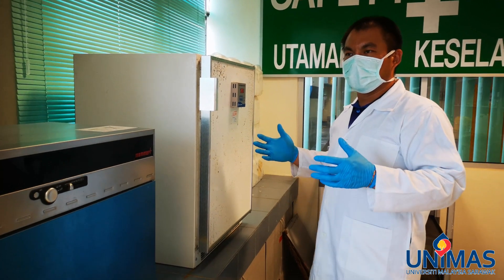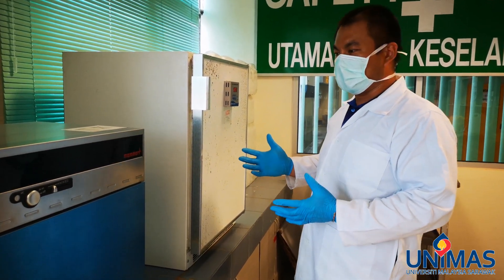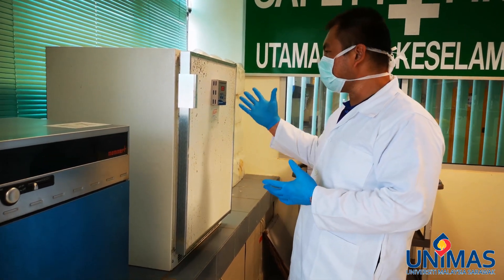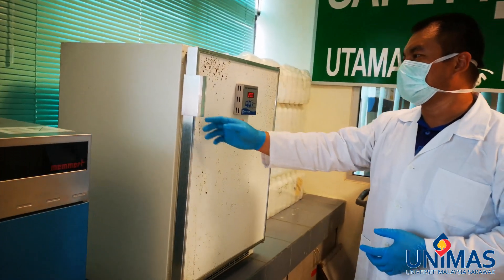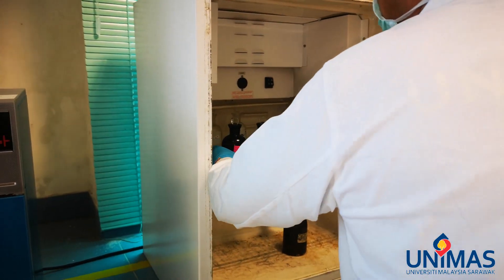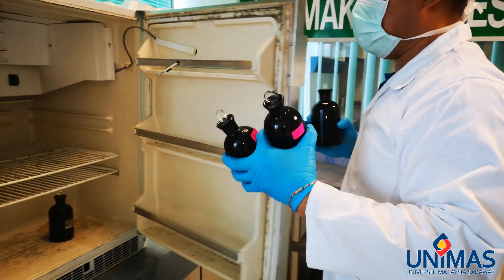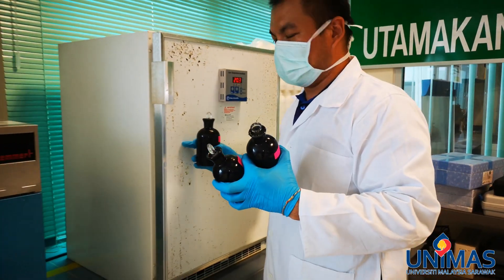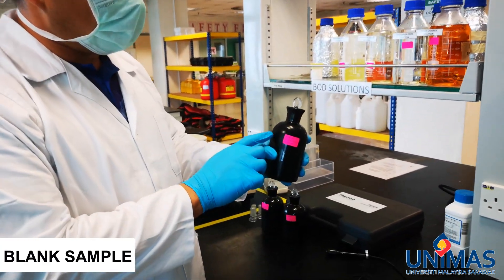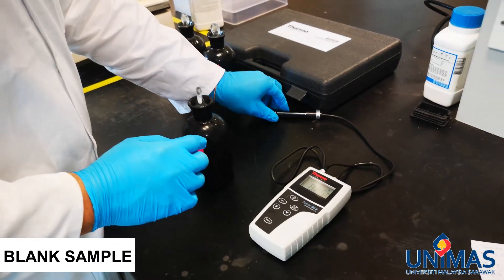It is now five days of incubation of the BOD samples at 20 degrees Celsius — today is actually day six. We are taking out the BOD bottles. This is the blank sample, and we are going to measure the DO.